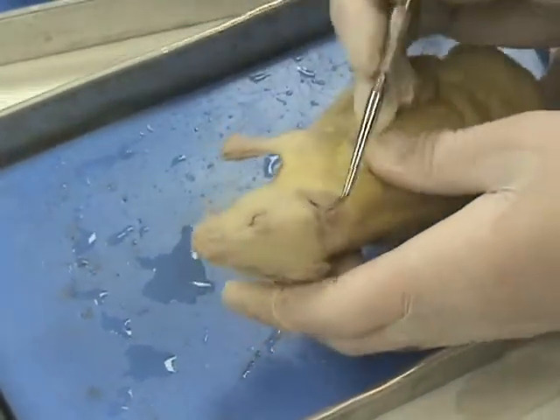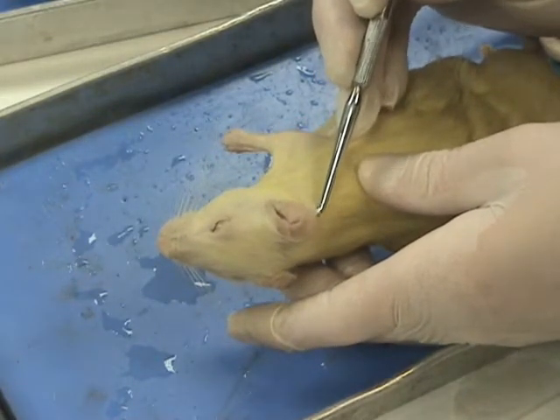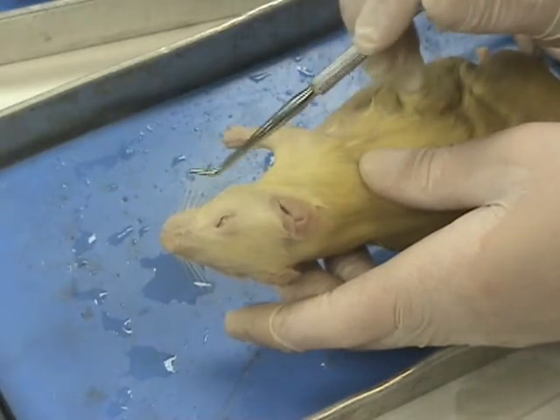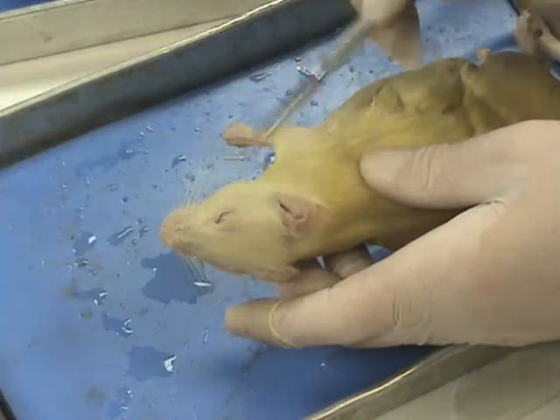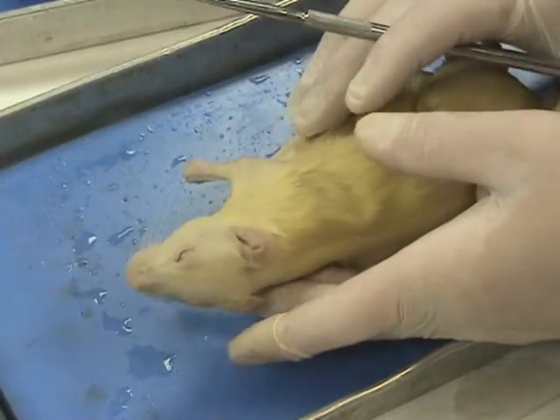The ears also have a scientific name. The ears are called pinnae, and the whiskers are called vibrissae. And what you are asked to think about is, why are the vibrissae called this? It has everything to do with the word vibrate. Think about how the rat might sense what's going on as this rat is awake, mostly at night.